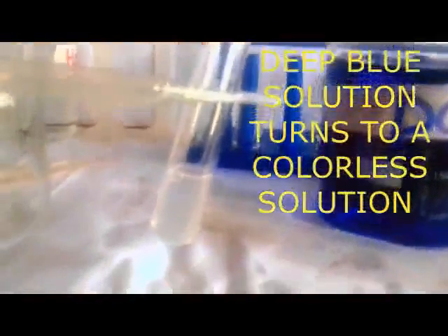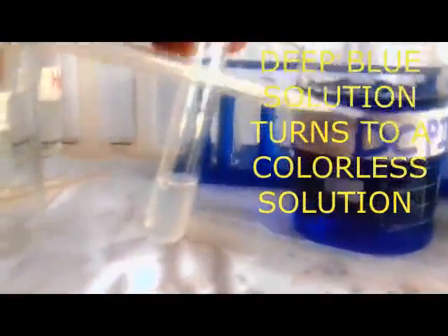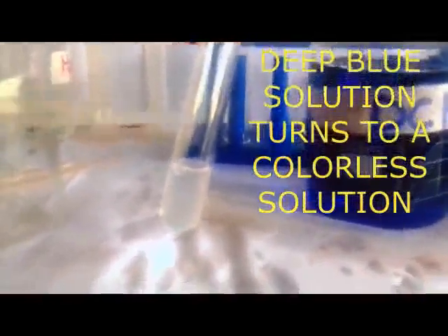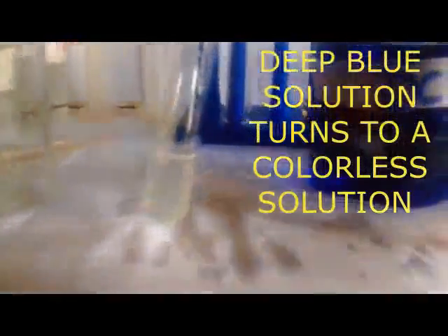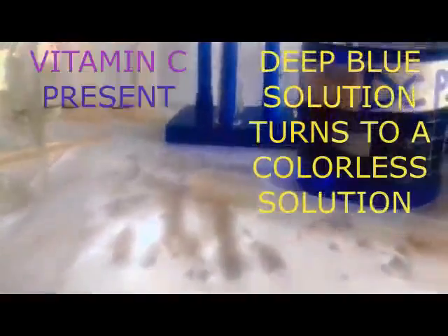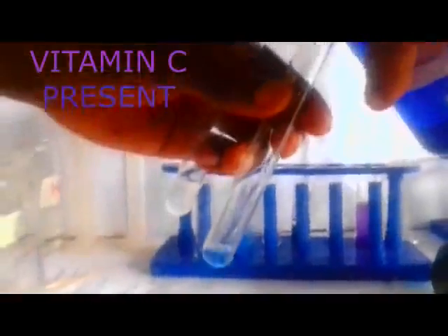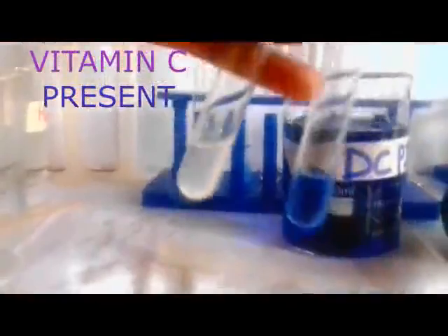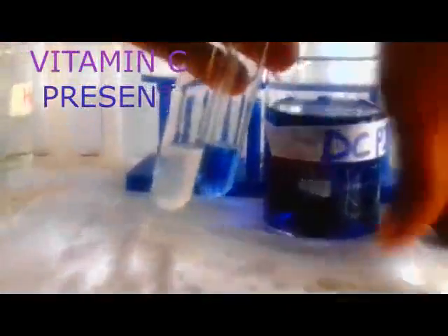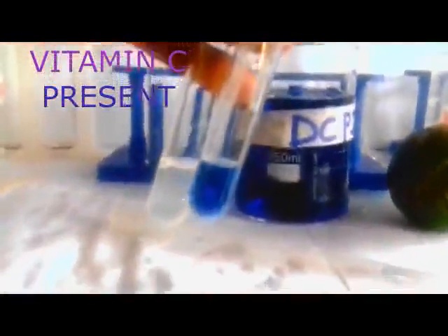In simple terms, here we are going to record that the deep blue solution turns to a colorless solution. Remember our reagent, which I have used, that is DCPIP. You can see members, the reagent, and then this is when I added the juice. Let me try to repeat and you see. I add my juice.